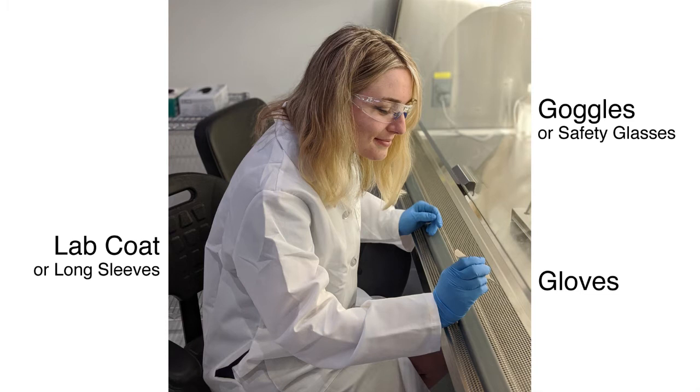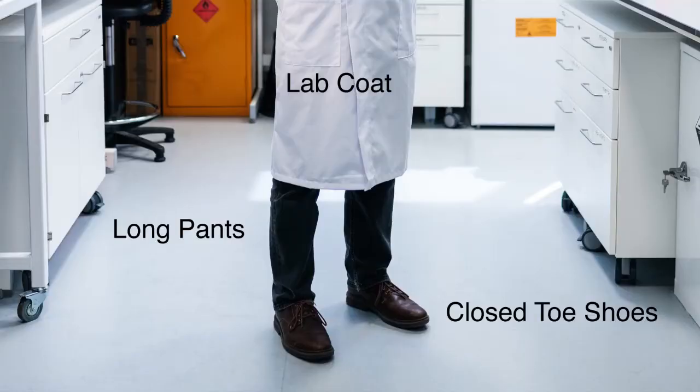Safety. Safety glasses, goggles, lab coat, gloves, and closed-toed shoes are required for this experiment.